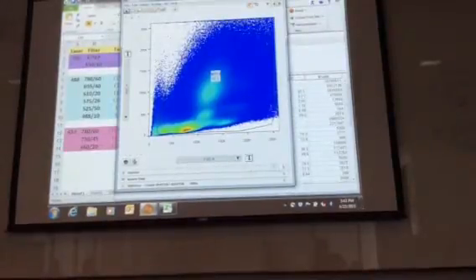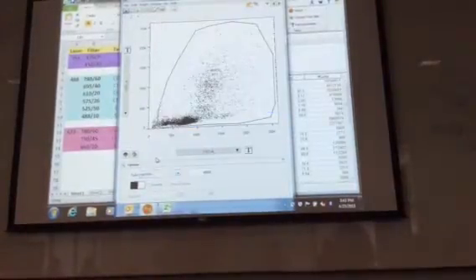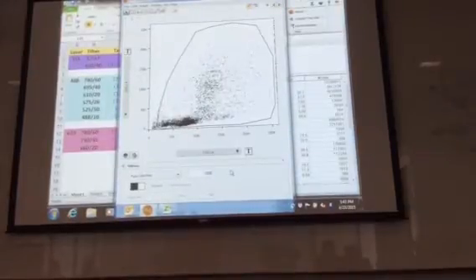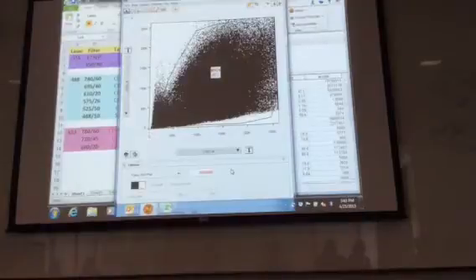What we're saying here is this is your pseudo plot, and you're seeing all the different cells. If you start looking at different things, like for example the dot plot, this is going to show you only 8,000 cells. But if you were going to do it on 2 million events on the dot plot, you have absolutely no idea where to draw the gates, but all the data is still there.